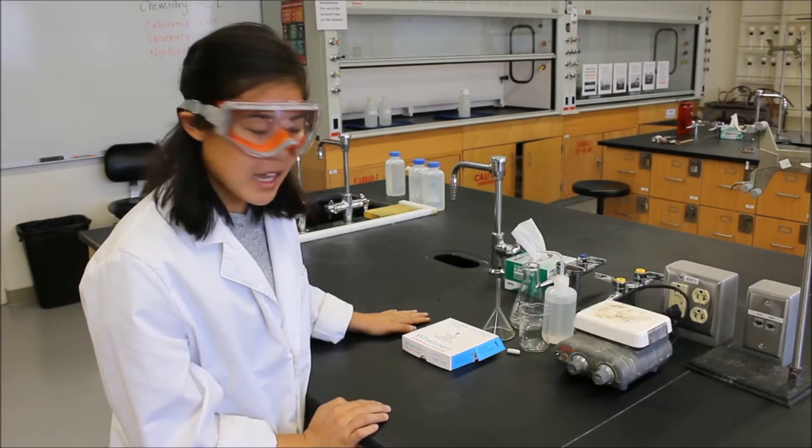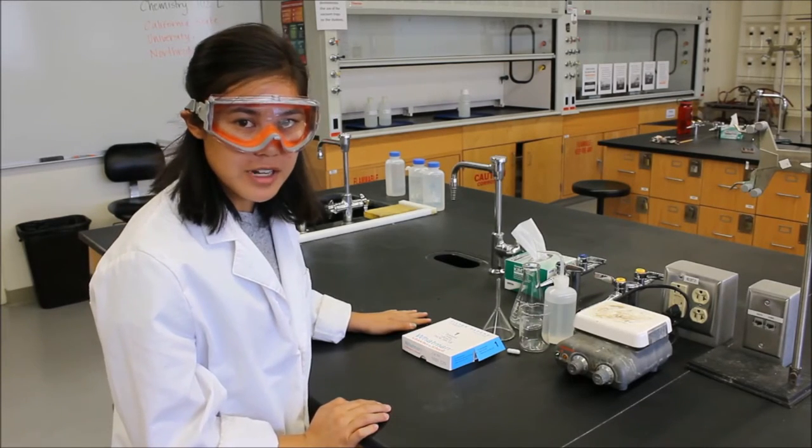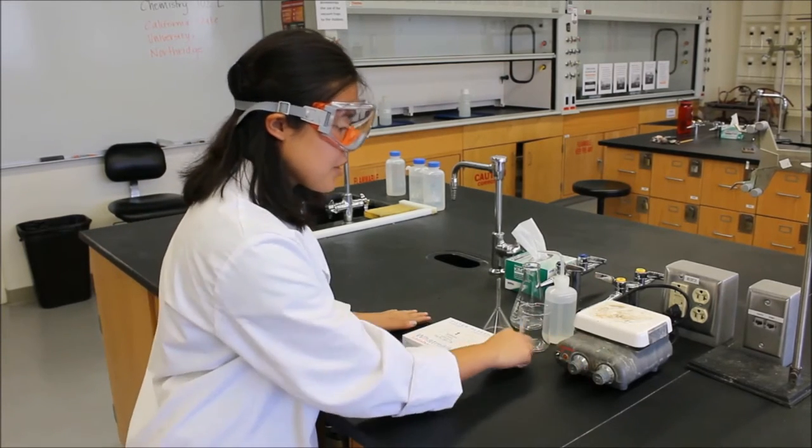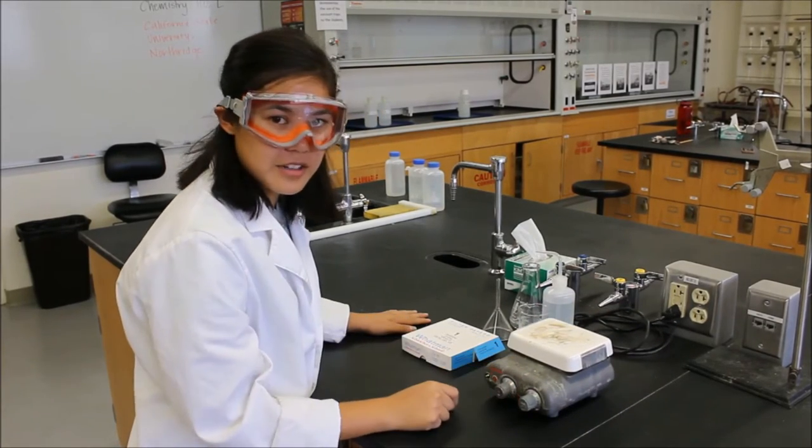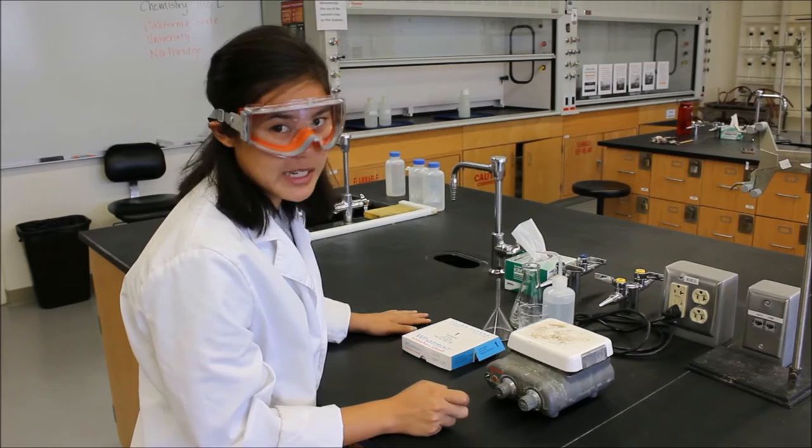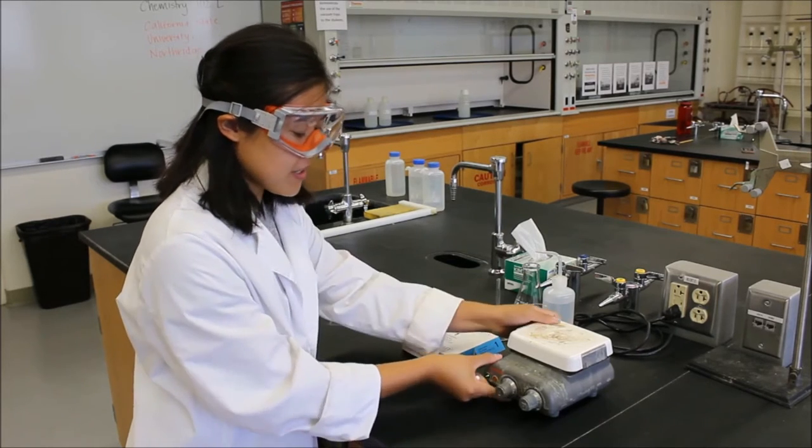So first what we'll do today is we're going to demonstrate how to use a stir bar on the stir plate. You'll notice that the stir plate looks just like a hot plate because it is a hot plate with the stirring function.